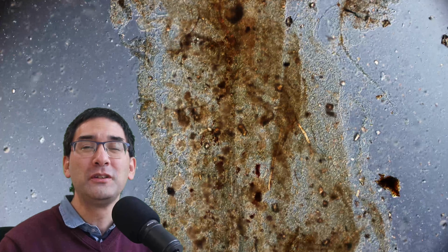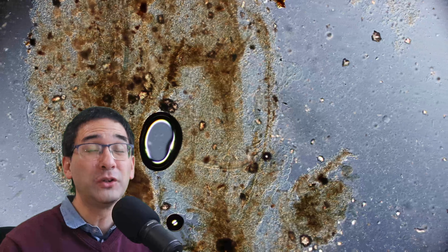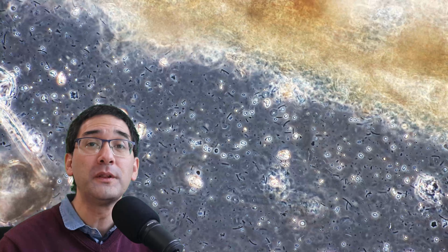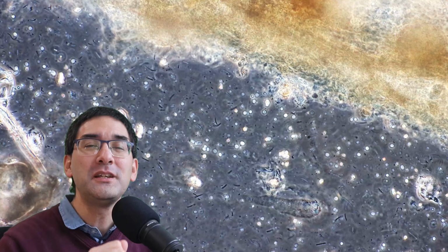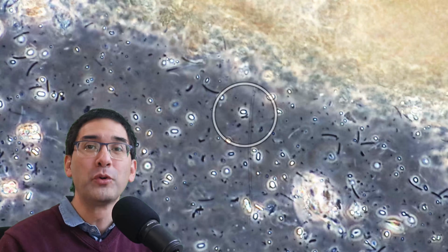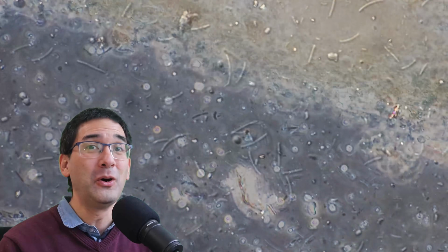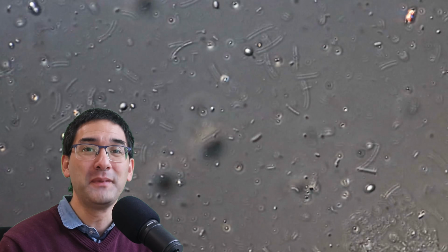At low magnification, a large air bubble, but not really much movement, really not very interesting looking. But when you actually use phase contrast and when you go up a little bit with the magnification, then I was able to see many tiny little bacteria, mostly the rods. Rods are long bacteria, they're elongated, but I also saw many cocci. Some of them were moving around. I'm going to show you those interesting specimens by putting a circle around them. And some of them also were spiral shaped, and also I saw some dividing bacteria as well.